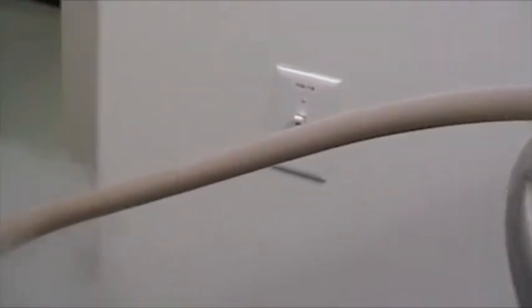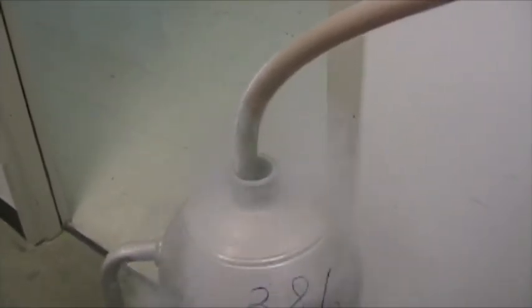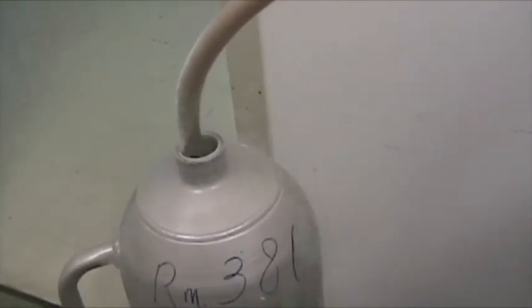And on the tube, which is frozen. Yeah, that tube is down in there much further than I want it to be. I may not be able to get it all to cool. So that's it — that's all there is to it.